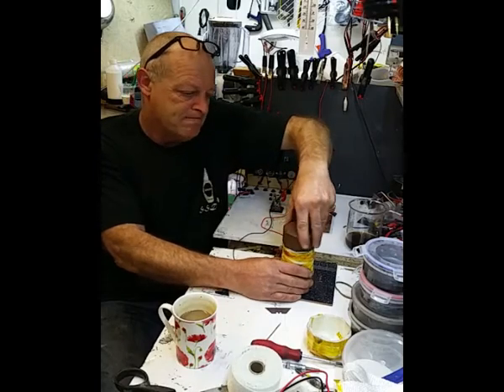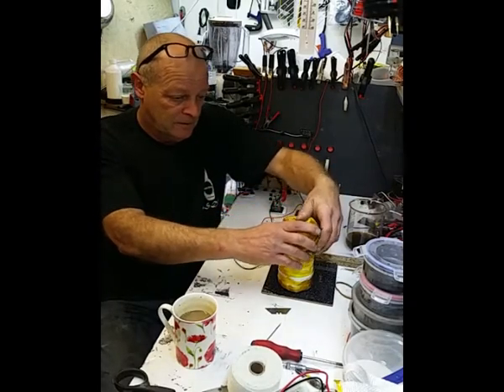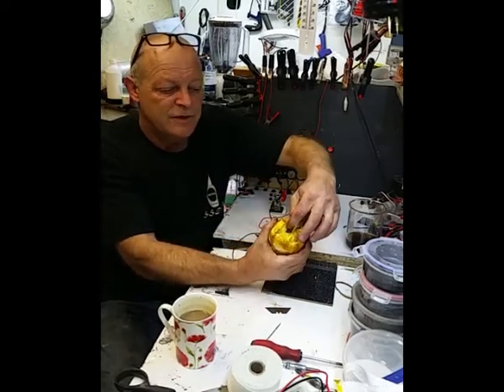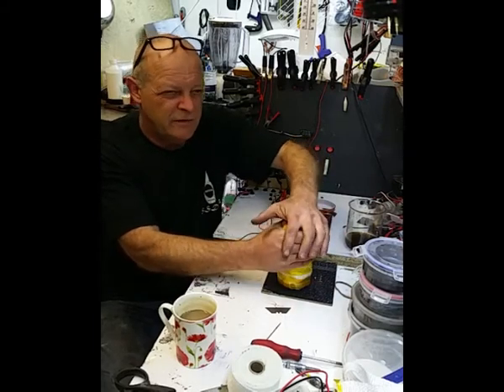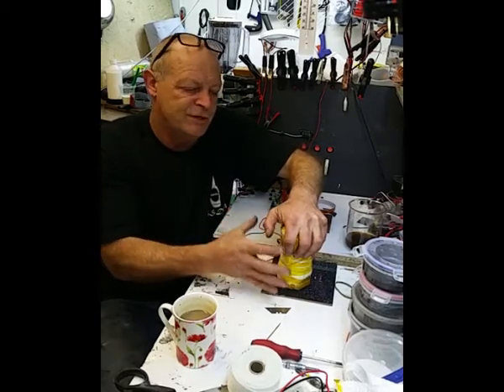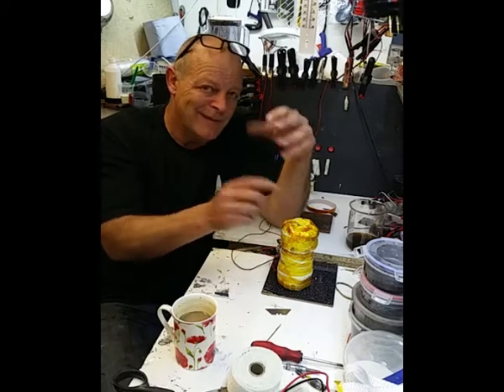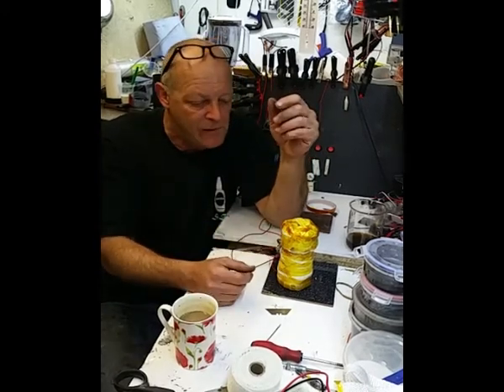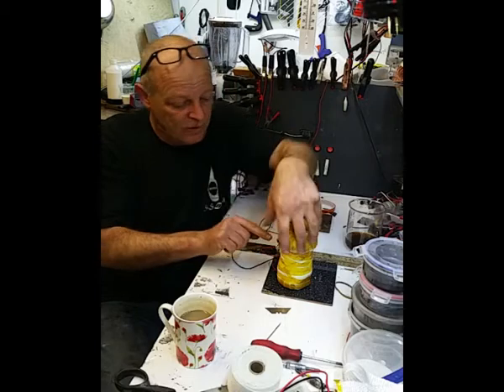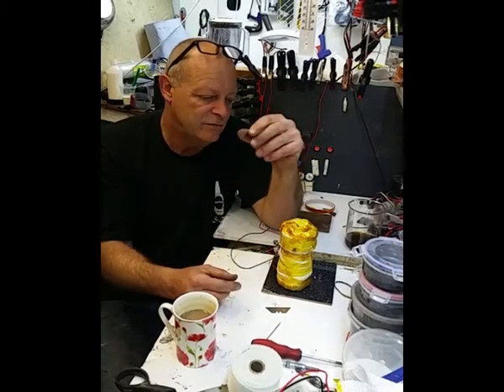That's my thermal barrier, and I made a nightcap for it. Look, just pop that on there like that. Now if you're wondering how I'm going to measure the temperature, I've left a little window there just to measure the temperature on the top. Looking at the earlier results, the temperature variations, this should now be better to give an even heat. Yes, the top may be just slightly higher than the middle and the bottom again, but I don't know. But I can also test the temperature on the bottom and the top. So hopefully we get some sort of an idea of where it's going.